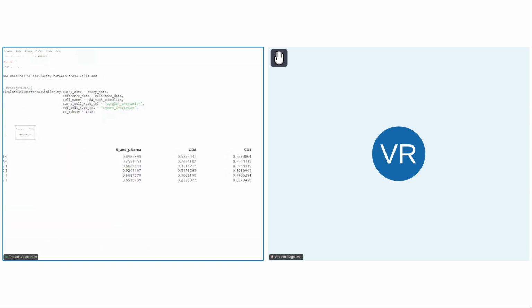And then finally, here is a function that computes something called the Hellinger distance, and another function that computes the Bhattacharyya coefficient, and it's a measure of similarity between specific cells and the distribution of that cell type. So for the Hellinger distance, the lower the value, the better. For example, if we look at this particular cell, the Hellinger distance for this cell versus the distribution of CD8 is very low. So that's a good indication. And then you can also look at the Bhattacharyya coefficient. The higher the value, the better. Obviously, it looks like most of these cells might actually be CD8 based on these Bhattacharyya coefficients. So I think I should stop here and take any questions. Thank you.